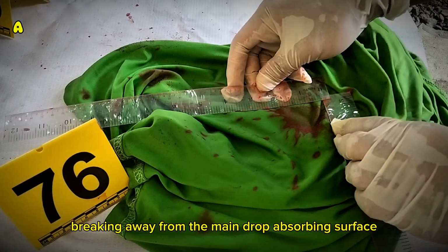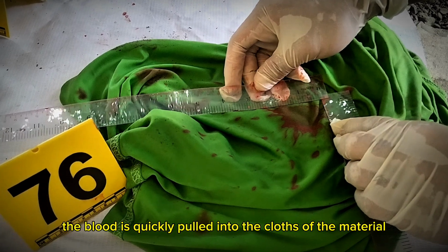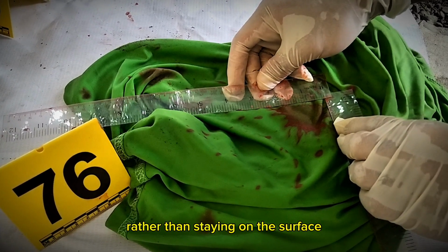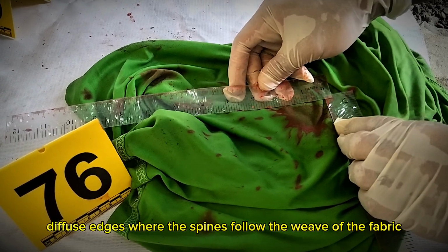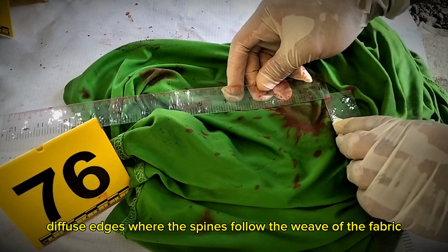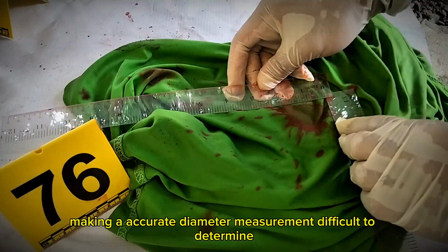On an absorbing surface, the blood is quickly pulled into the cloth fibers of the material, which causes the stain to spread internally rather than staying on the surface. This creates fuzzy, diffuse edges where the spines follow the weave of the fabric, making an accurate diameter measurement difficult to determine.